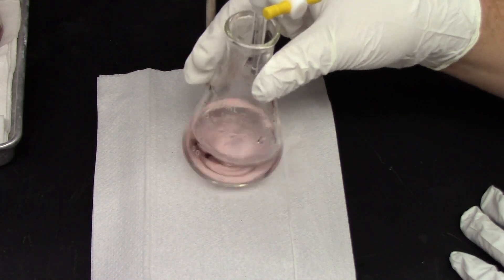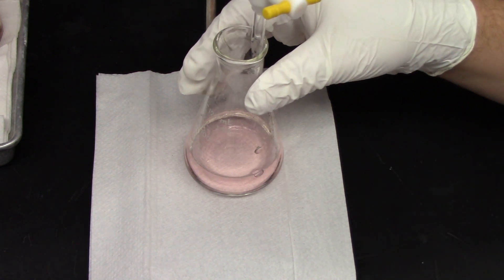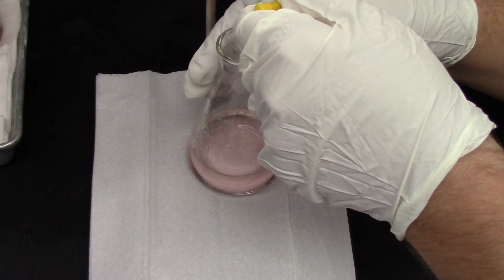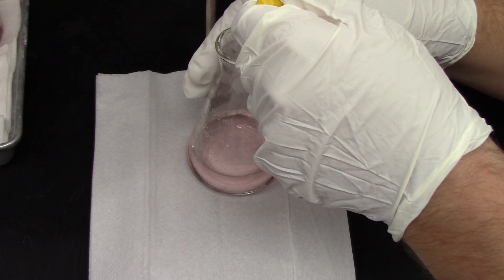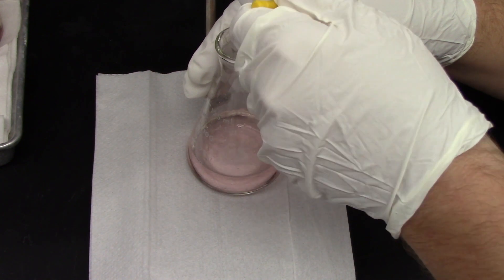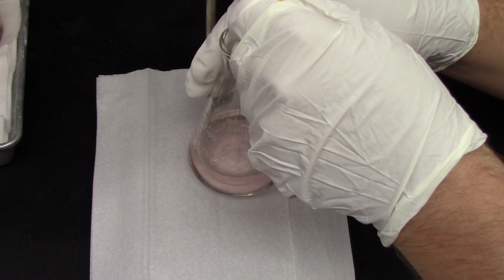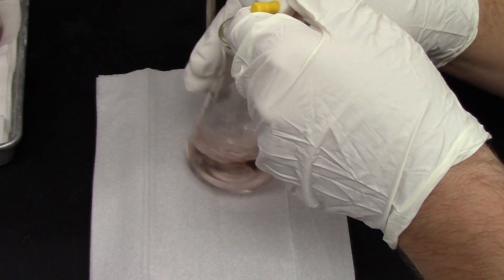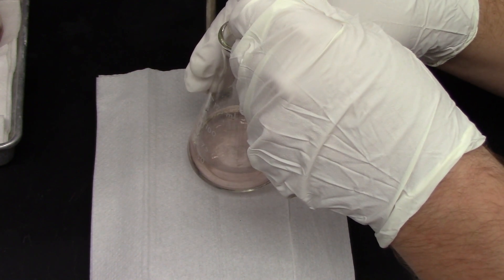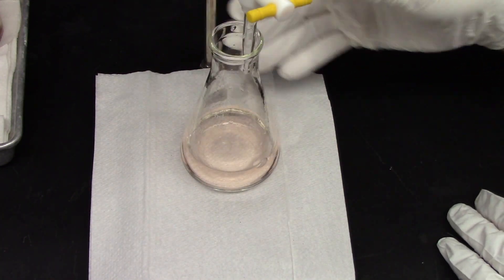As you can see, the solution got really yellow really fast, but it's still somewhat pink. So let's add another drop of base. There we go. Still a little pink, add a little more. Yep, a little bit more yellow, add a little more base. There. I'm going to call that the end point because that looks very yellow to me.